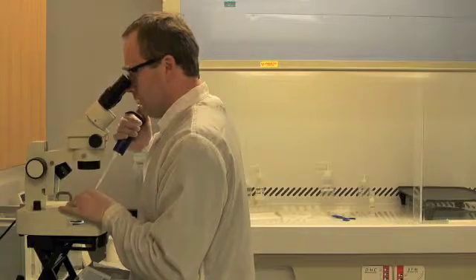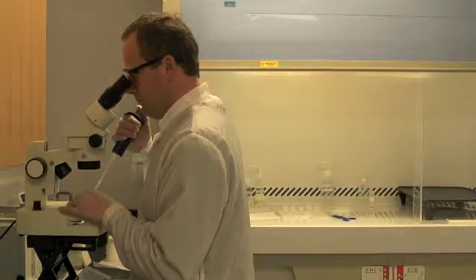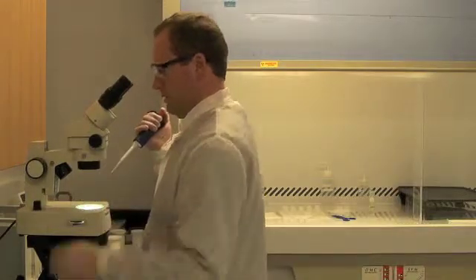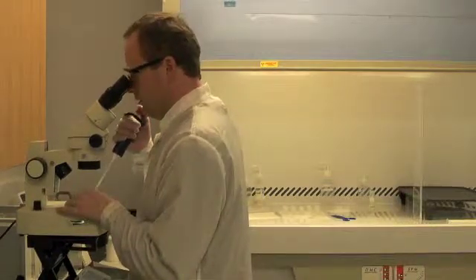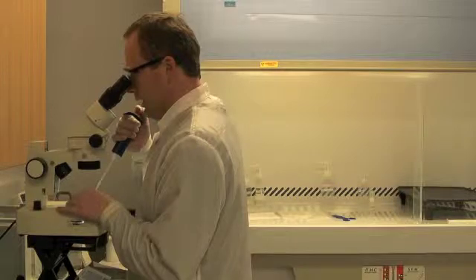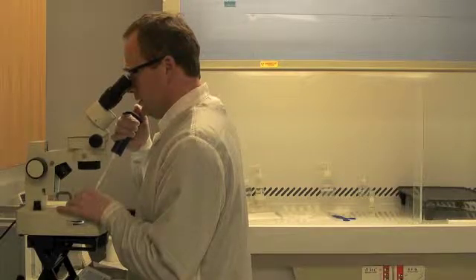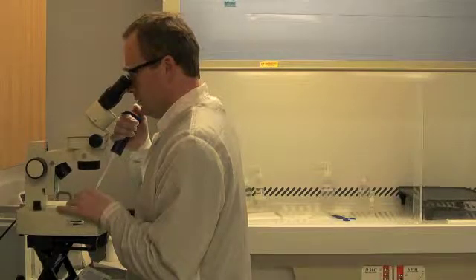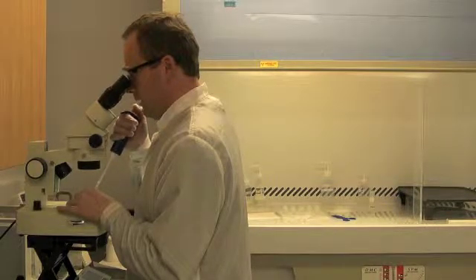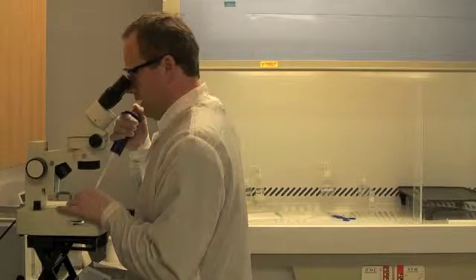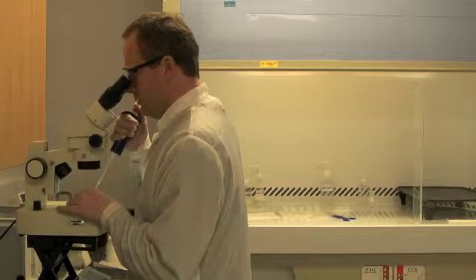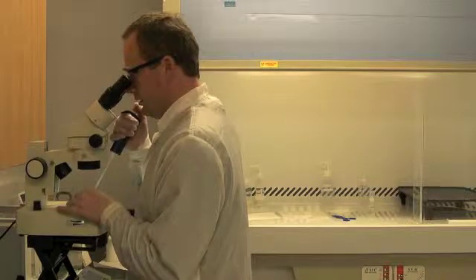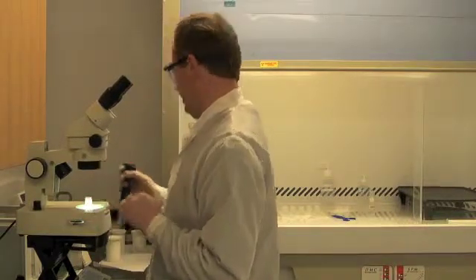I'm going to pick that crystal up, discard the acid, place the crystal back in the beaker. Pipette as much of that liquid away as I can, leaving the crystal in the bottom.